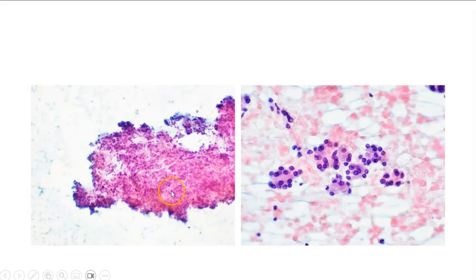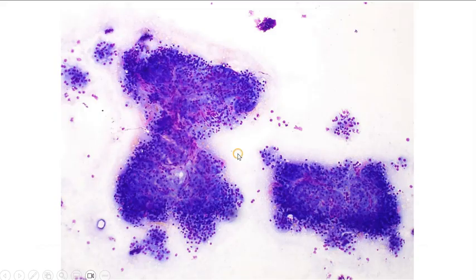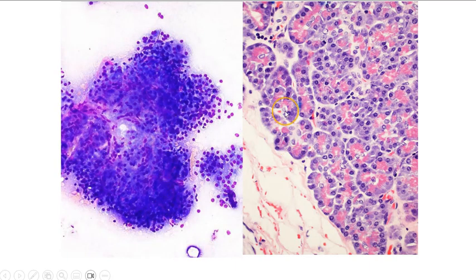So here is a whole lobule that has been aspirated, and we can see very clearly these acinar structures within some stroma, whereas here we can see sort of naked acinar structures, and this is not to be mistaken for neuroendocrine tumors. Here again we have a lobule where we can see the acini, the intact grape-like structures, and a little bit of stroma in between. And this is just to compare with normal histology of the pancreas, where we can see individual acinar structures. So the cells have low NC ratios, eccentric nuclei, and somewhat granular or loose cytoplasm.